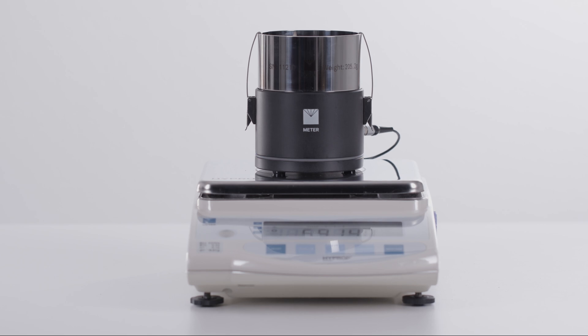Degassing the water can be done using two different methods. The refill unit accessory method is simple and fast. The syringe method takes time and requires more manual labor. Here we'll show the refill unit method. For details on the syringe method refer to the manual.